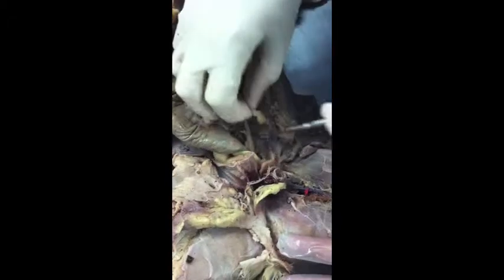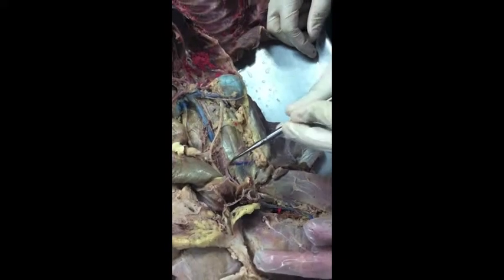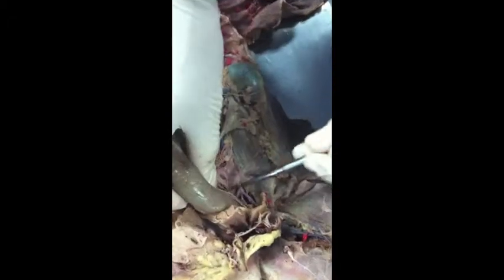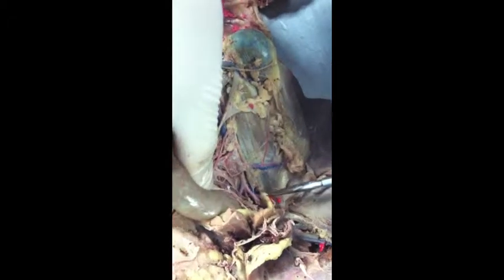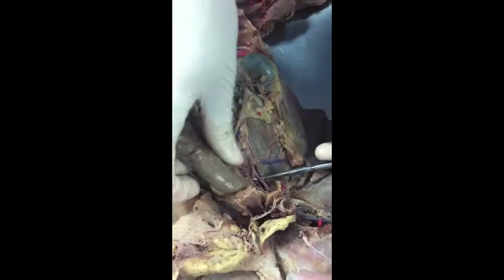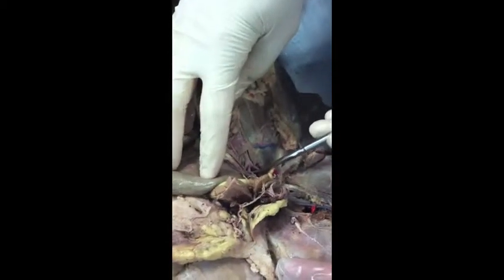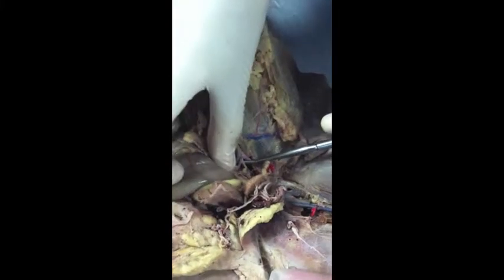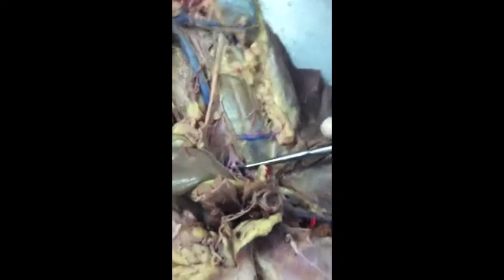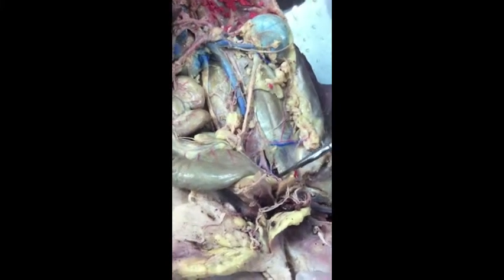All right, so we're past those. What are these guys? Lumbar spine region. Iliolumbar artery and vein. Okay. So the aorta is going to branch into two sets of forks. What's the top set? The iliac. External iliacs. And these guys, this set of forks? Internal iliacs. External on top, the big ones. Internal, the little ones.